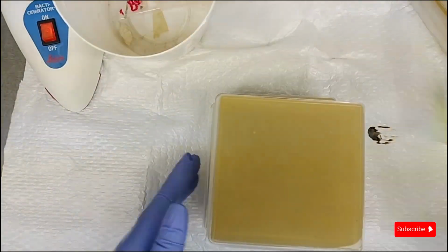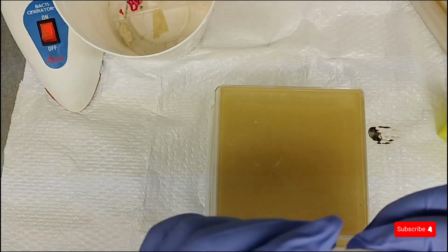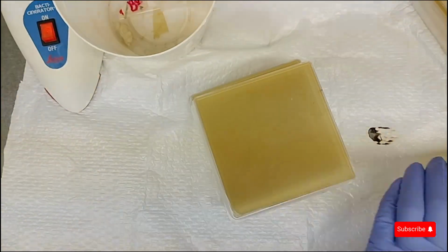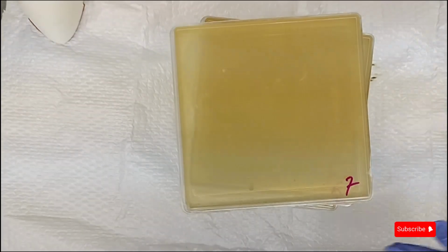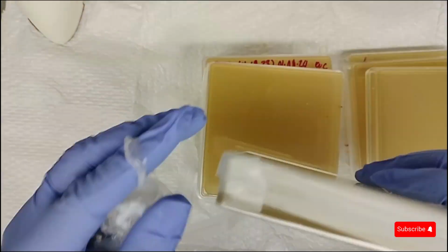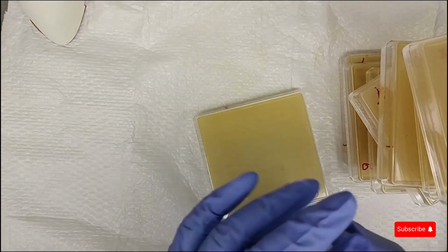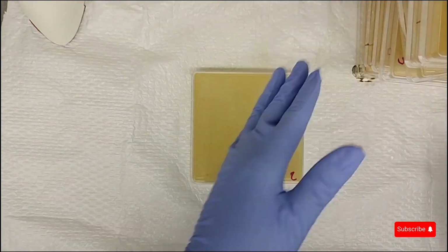But yeah. I retrieved the pre-made agar plates from the 4 degrees Celsius fridge, and as a standard practice, I avoid making the plates on the same day I inoculate them, but if it's unavoidable, I make them up first thing in the morning, then inoculate in the afternoon. So inoculation is a process by which the inoculum, a pure culture of the microbe, in this case the spore suspension, is transferred to the growth medium, which is the agar plate, using techniques that minimize the introduction of unwanted microbes, aka contaminants.